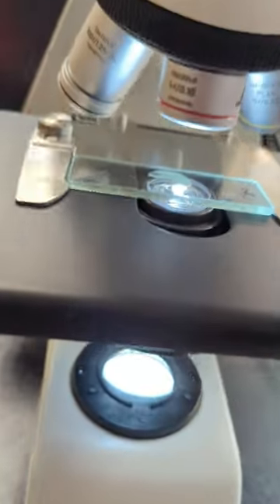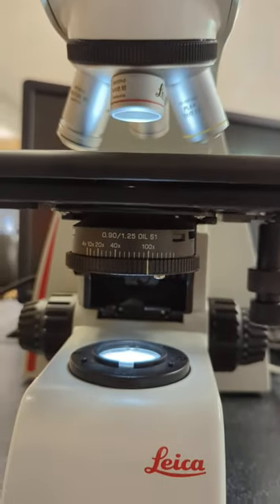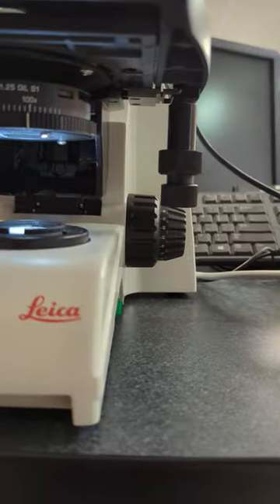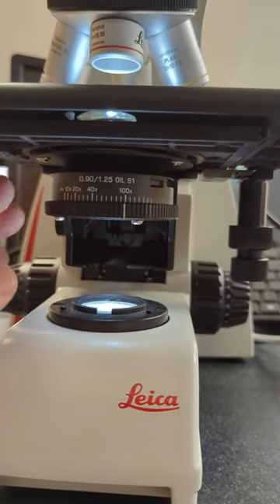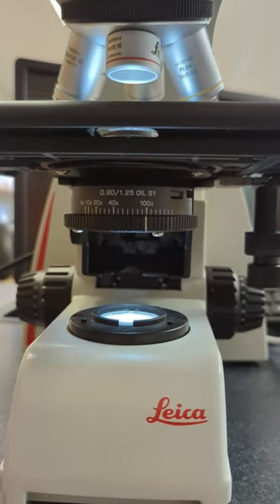There's no other adjustments on this microscope other than your condenser and objectives. There's no focusing this—it's all pre-focused and pre-centered for the condenser.